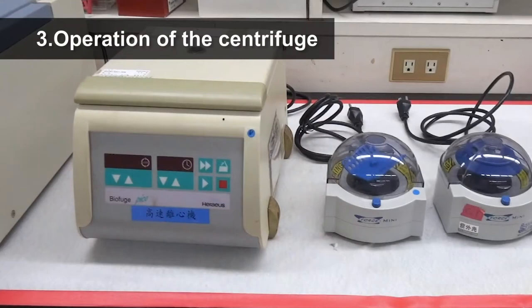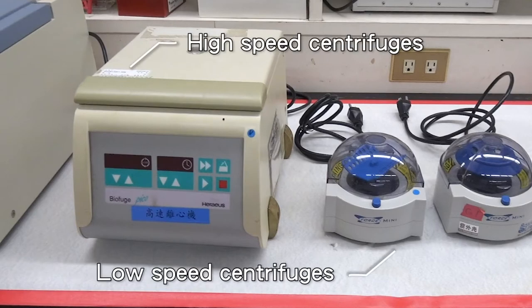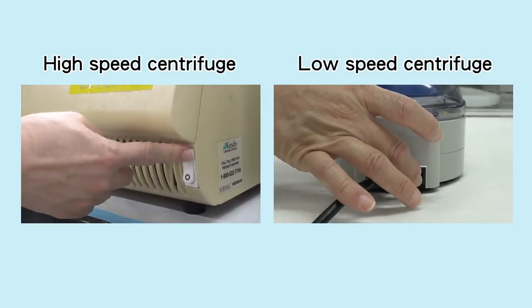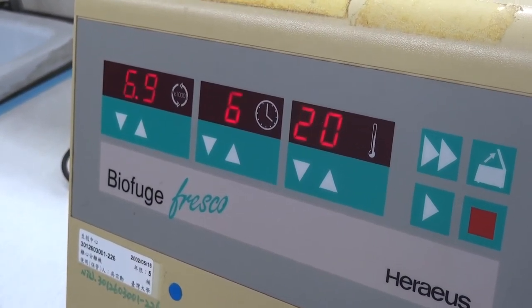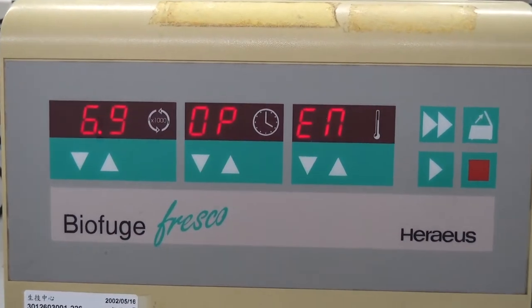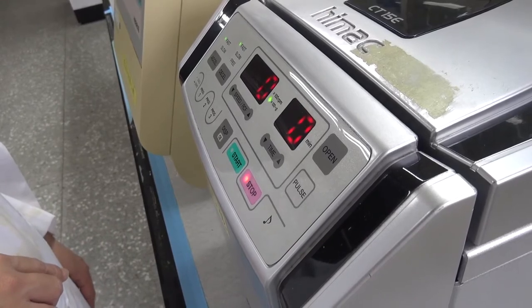Operation of the centrifuge: The first demonstration will be for a tabletop microcentrifuge, which comes in two types — low-speed, commonly called the 'little turtle', and high-speed. Plug it into the electrical outlet and turn on the power button if there is one. A high-speed centrifuge has a panel displayed in front and will start the self-test procedure automatically. The device can be operated after the panel shows the letters OP. Some devices may even have a music setting button for a prompt at the end of centrifugation.